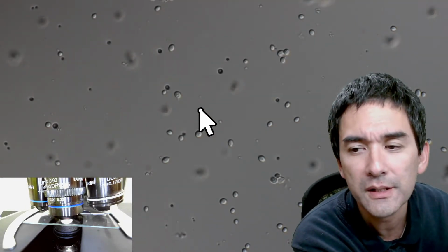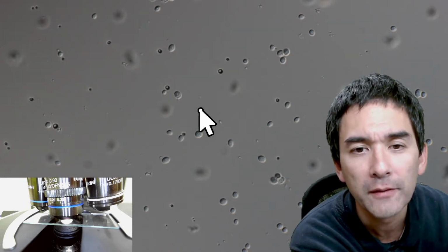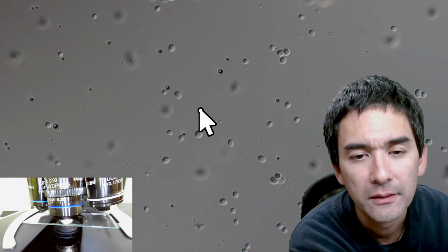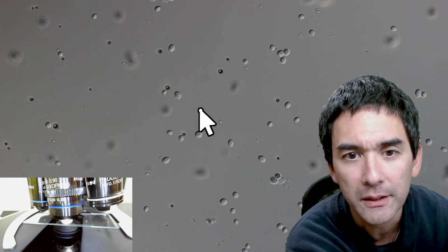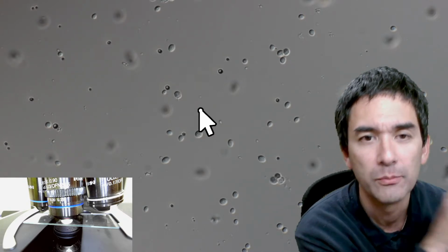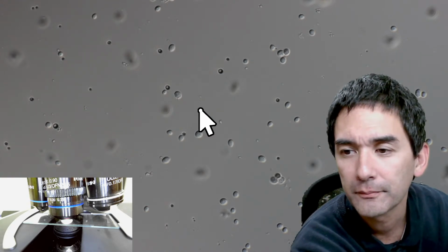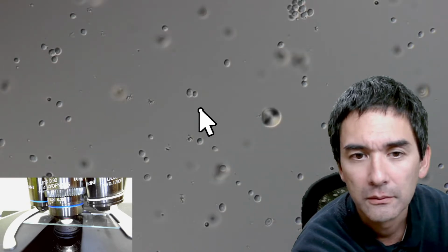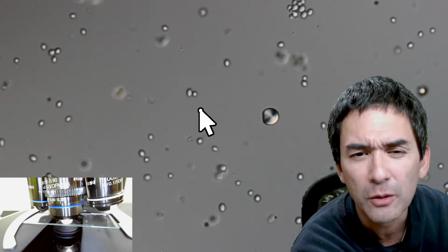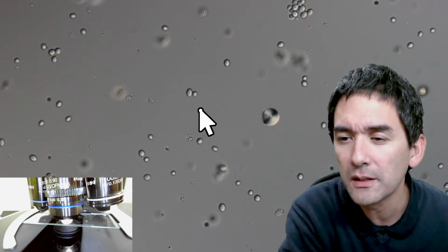What you can do is you can also add a little bit of sugar, and after a couple of hours you're actually going to see them divide. You can see them at this typical asymmetric division called yeast budding, where you have a small bud growing out of a yeast cell. Okay. What are these air bubbles? I don't know. But you get the idea. So these are basically yeast cells.